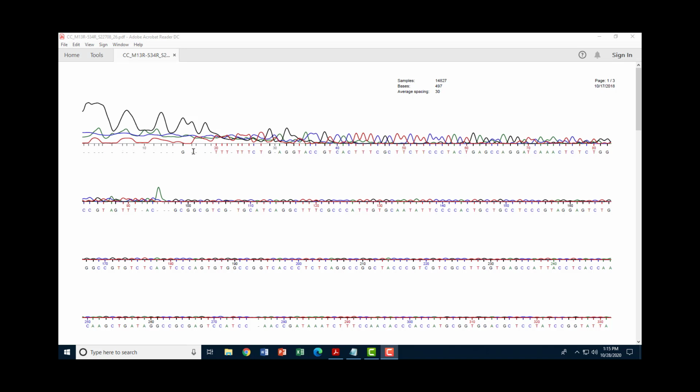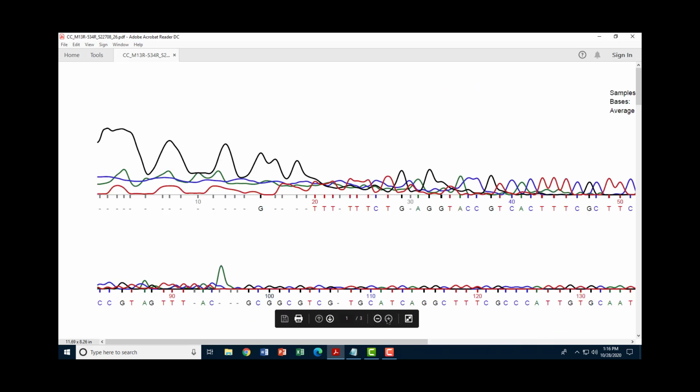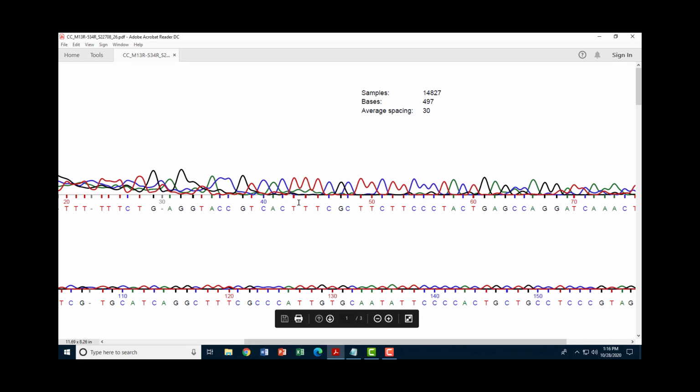The machine at the beginning of its run was having a lot of waves that were complementary to each other, overlapping each other, and it really couldn't determine what was what based on that. But then when it got to here, it started getting more confidence in what it was seeing. And by the time we get to here, we can see very clear peaks corresponding to different bases. So we'll take a closer look at some of these. Like for example here, right here. We look at this sequence here. We have this black peak, which corresponds to guanine. Then we have this blue peak, which corresponds to cytosine. Here we have red and red. That's thymine and thymine. So the machine is capably and easily reading the bases at this point.